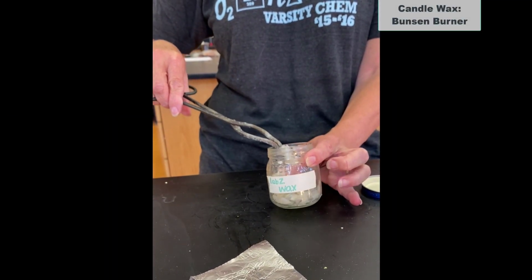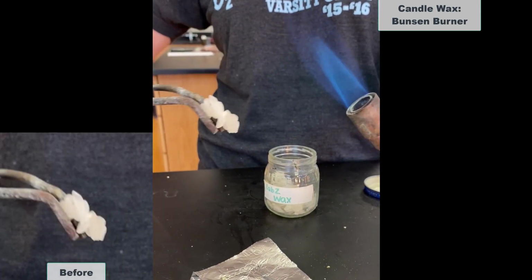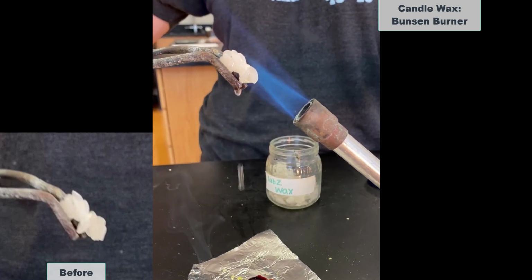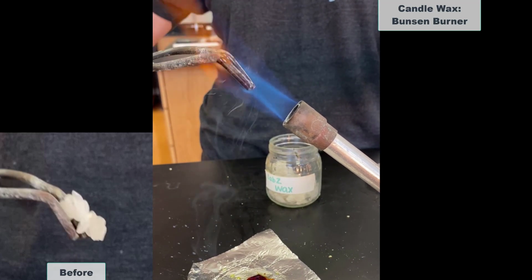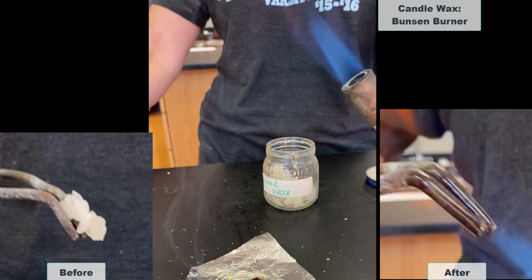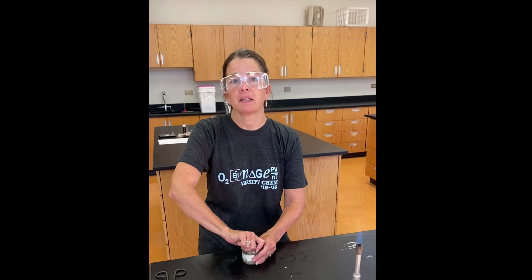And our last one we're going to do is candle wax. There it is before. Now, your job from here is to try to figure out the sequence of their melting points.